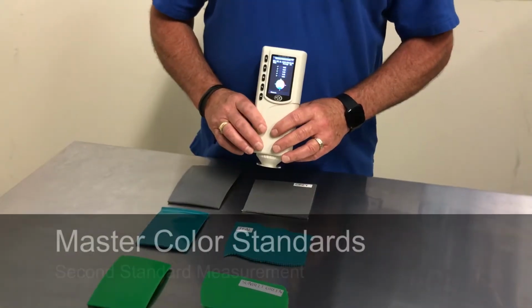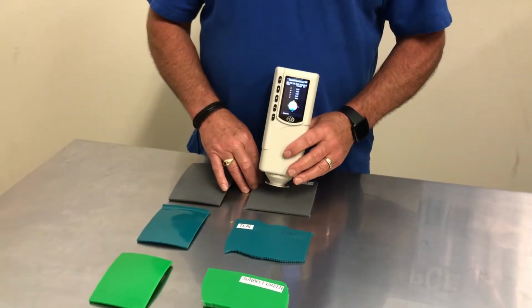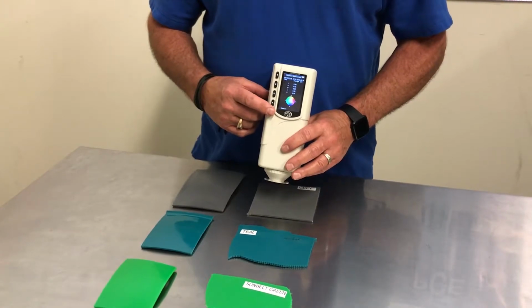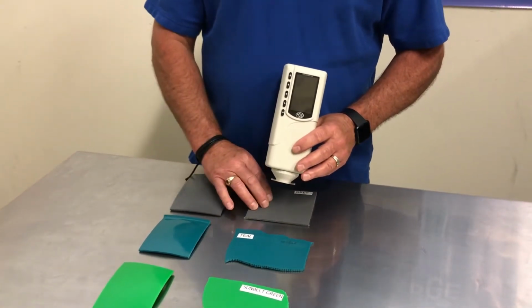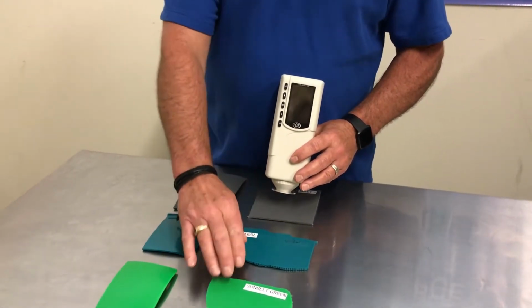The next step for a different color standard is to repeat the same procedure. Remember that the standard that is recorded is categorized by a number. You will only have one until you have another standard for a different color. Do this to obtain 3 different color standards.